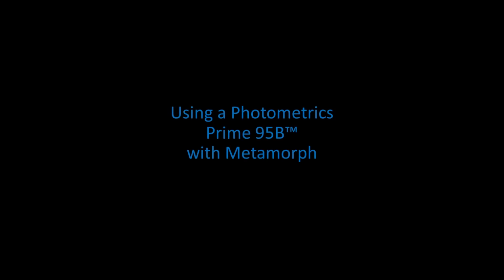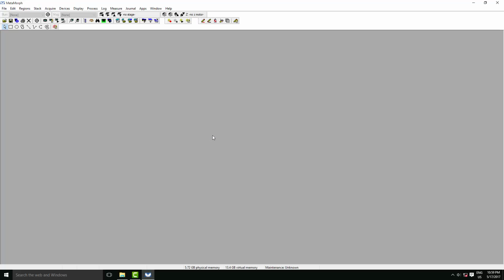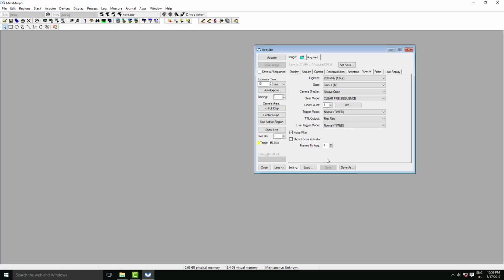In this video, we're going to look at using a Prime95B inside MetaMorph. First of all, we'll have a look at some of the features of the camera. Just to quickly load the camera into MetaMorph, one setting you always have to change, as MetaMorph activates it by default, is to deactivate this noise filter. We'll come back to that later.